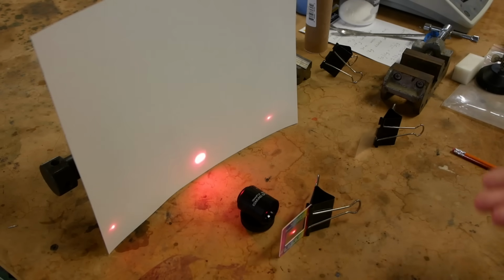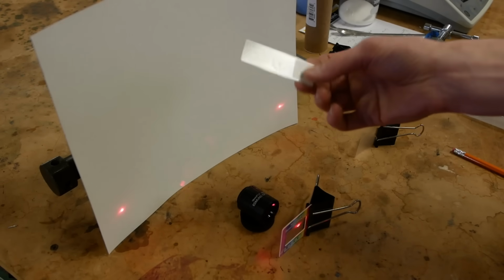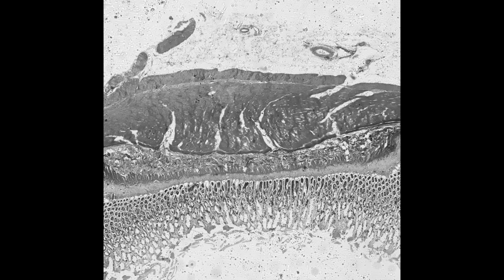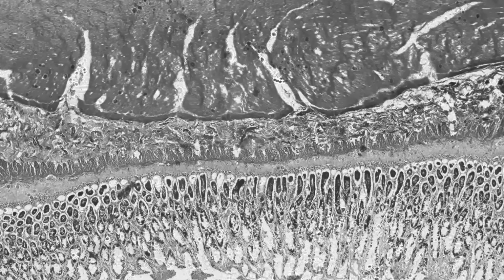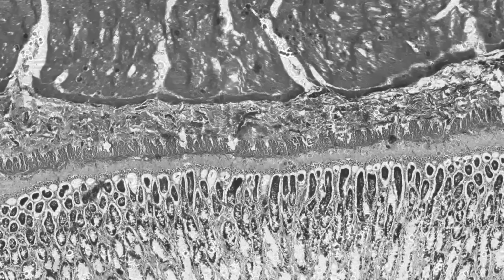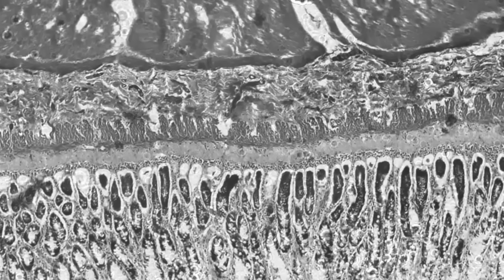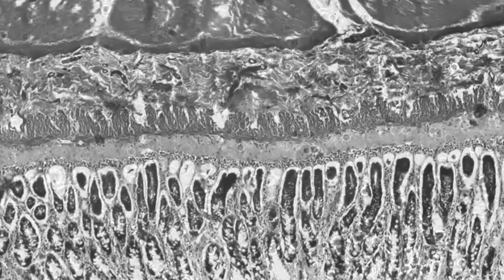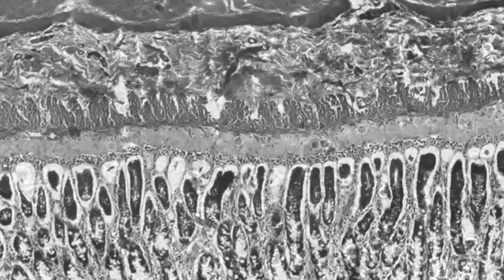Now you might be saying, well, sure, this works for diffraction gratings, but what about a real slide that has an actual sample in there? I mean, that's not a diffraction grating. Well, actually, it kind of is. I mean, light diffracts whether you want it to or not. And so even very complicated images like an animal cell or a plant cell or whatever you're looking at with your microscope, all of the same features that cause diffraction in a grating are also in a real sample.